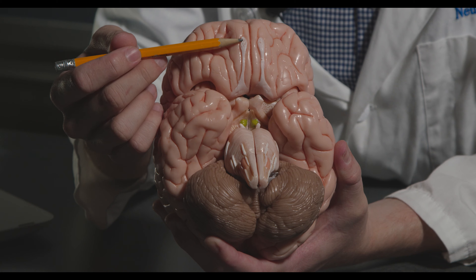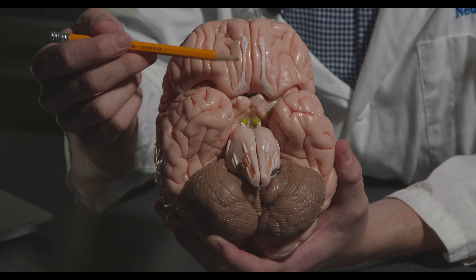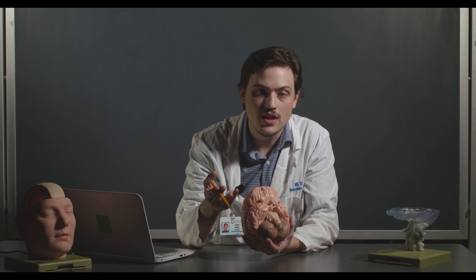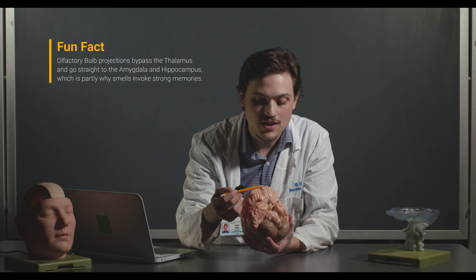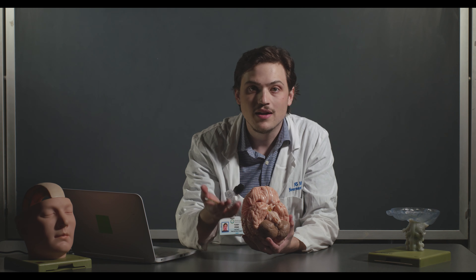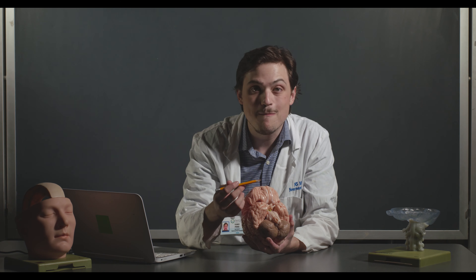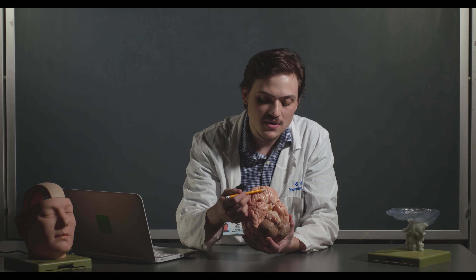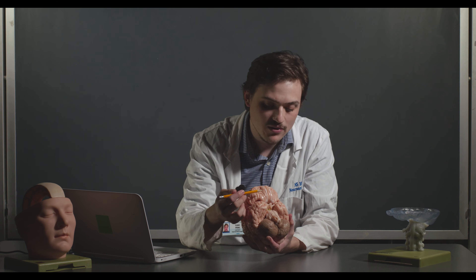The first things you can see are the olfactory bulbs. Notice how they're much smaller here than in the sheep brain or a rodent brain. It's interesting that across many mammals, structures are in the same anatomical regions, but rodents rely heavily on their sense of smell, so their olfactory bulbs are massive relative to the cerebrum. In humans, not so much. Cranial nerve 1 comes out of the olfactory bulbs, which we'll cover in the cranial nerve lecture.